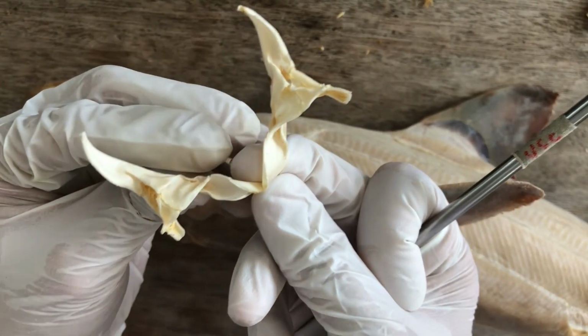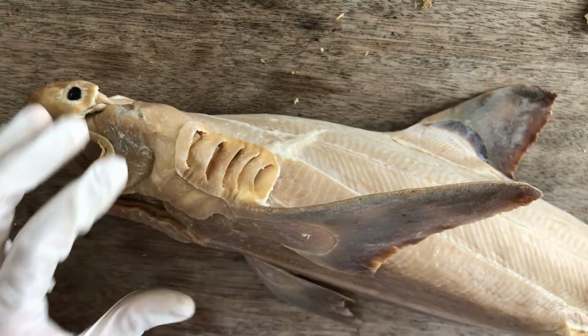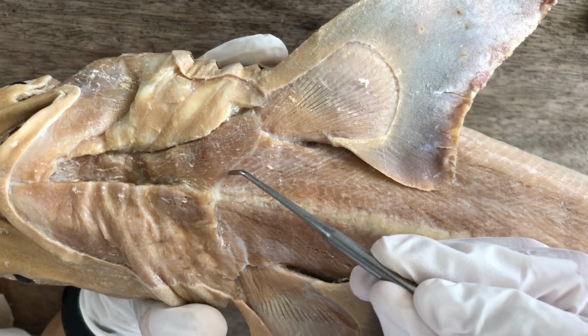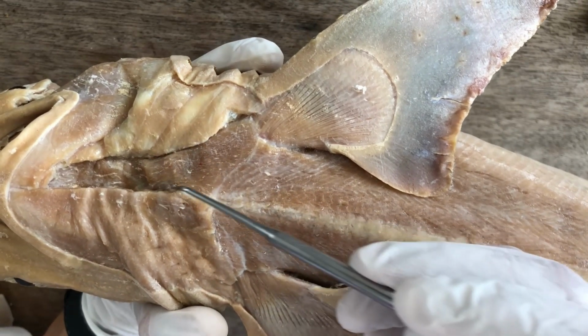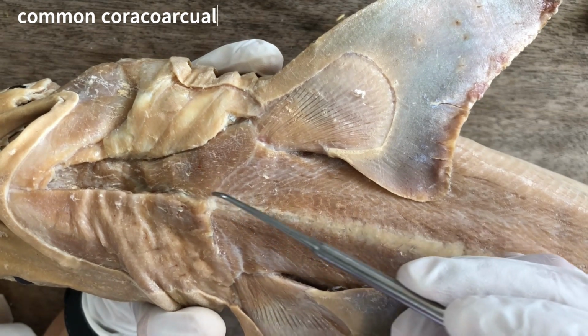This one, the coracoid bar. So it appears in our plastinated specimen as this white cartilage here. That's the location of the coracoid bar. And originating from it is this chunky muscle here, the common coracoarcual.